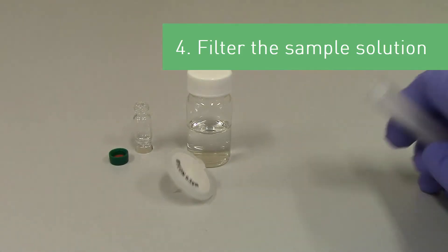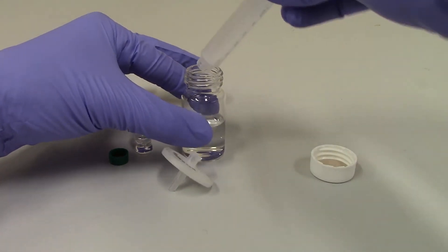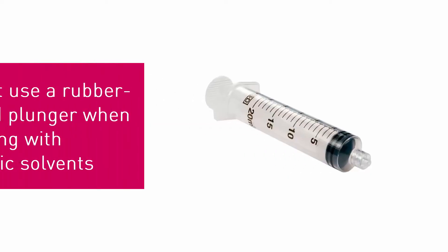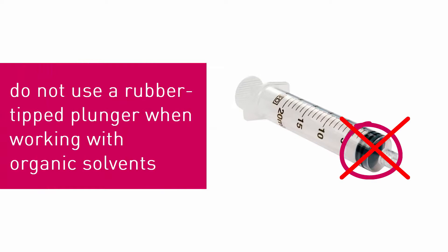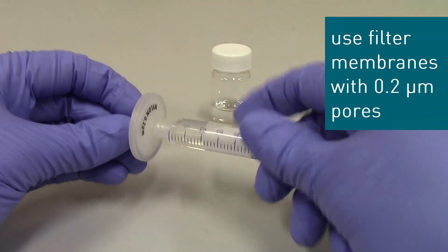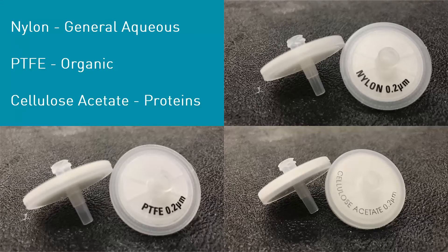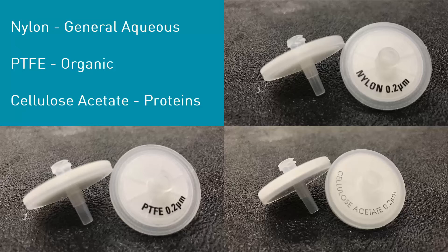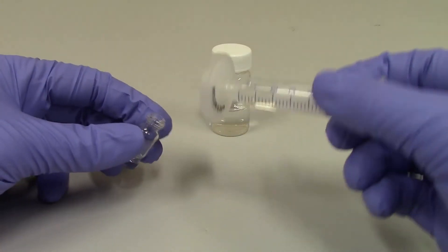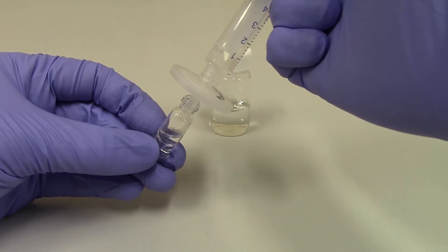Now that you have a homogeneous sample solution, the last step is to filter it. It is important to use a syringe and a syringe filter that are compatible with your sample solution. For example, do not use a syringe with a rubber-tipped plunger when working with organic solvents. Regarding the filters, we recommend filtering all sample solutions through a syringe filter with 0.2 micrometer pores. These syringe filters are available with nylon membranes for general aqueous sample solutions, PTFE membranes for organic sample solutions, and cellulose acetate membranes for aqueous protein solutions. If you are using an autosampler, you can filter directly into autosampler vials. This will remove any insoluble material or other particulates that can damage the instrument, column, and detectors.